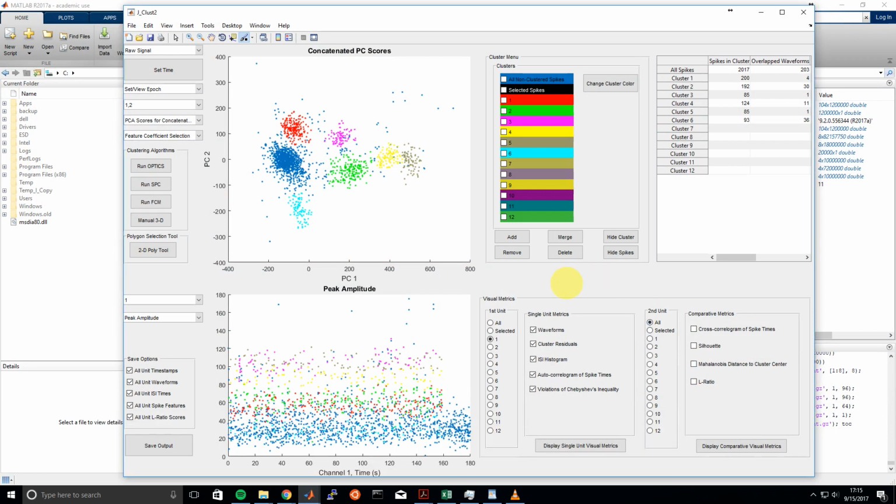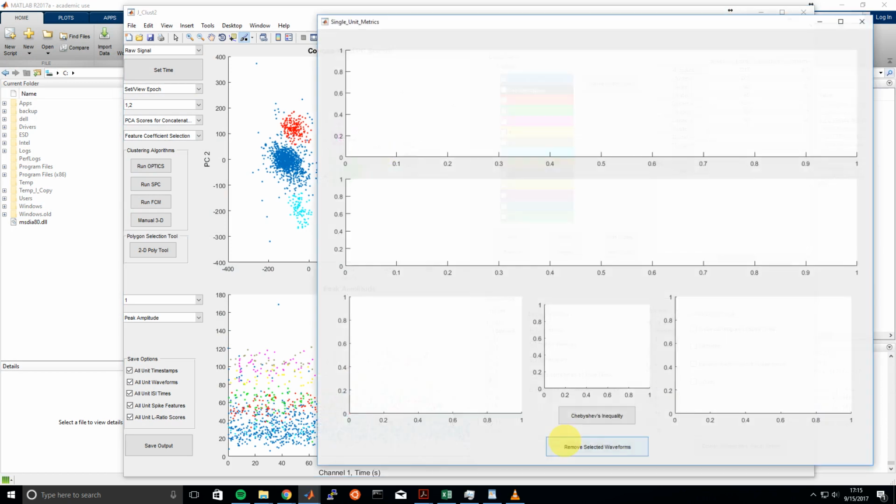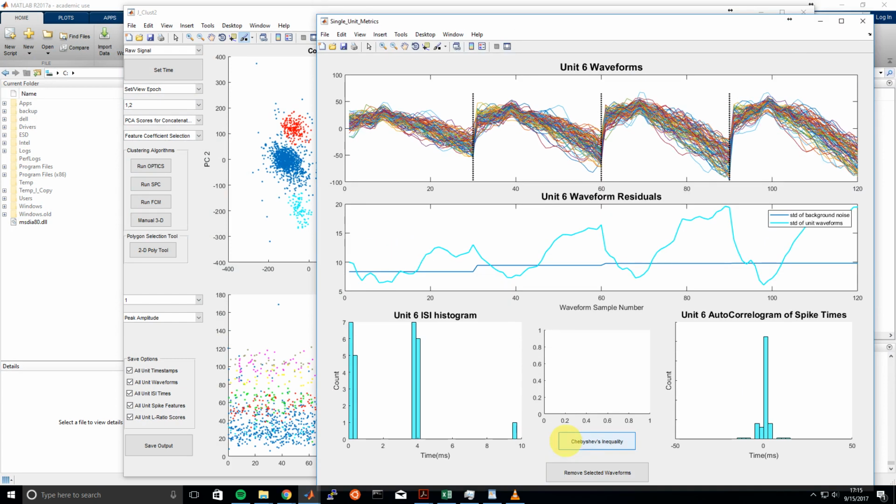Okay, so that's kind of what the metrics look like for a good unit. And now let's look at another unit near the MUA here, and this cluster is cluster number 6, and so we'll go through the same steps. So we'll select everything, we'll display these metrics, and right away we can tell that this is not a true unit. The waveforms don't resemble an action potential, they're super noisy.